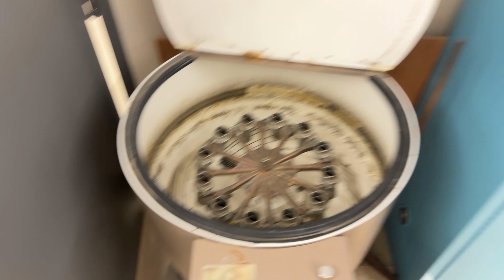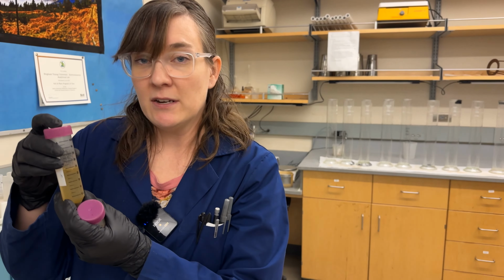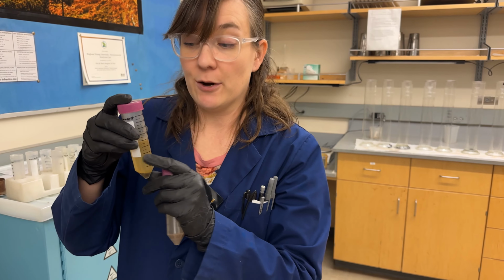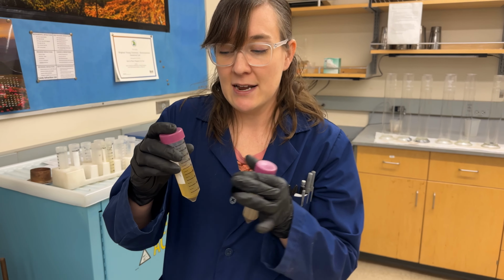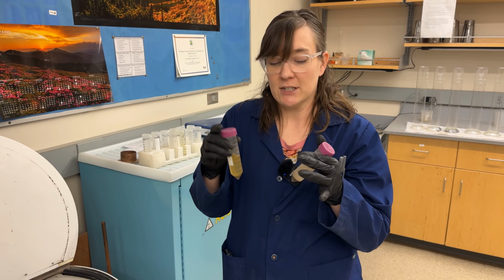This one has a little bit of color in it. So we didn't add any activated carbon. What we would need to do is re-extract this, add a little bit of activated carbon to make sure that this solution is clear. We don't want it to be gray from the activated carbon. So sometimes you kind of have to redo it a couple times until you get it right. We usually don't add any to start with, and then if it does have color, we'll re-extract it.